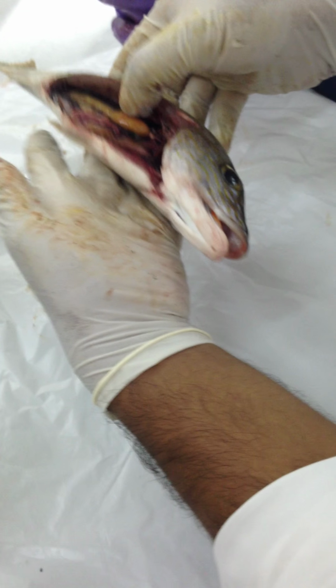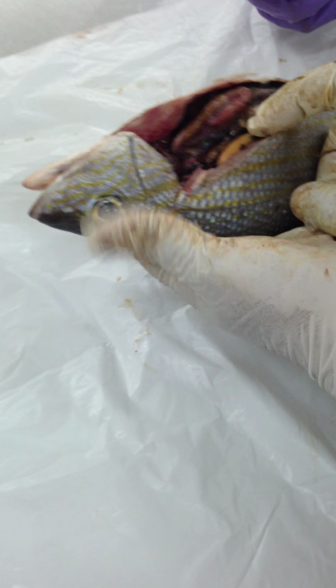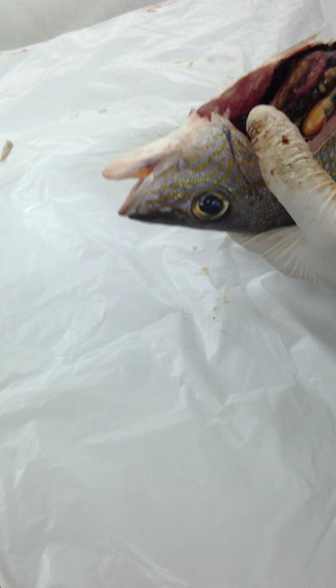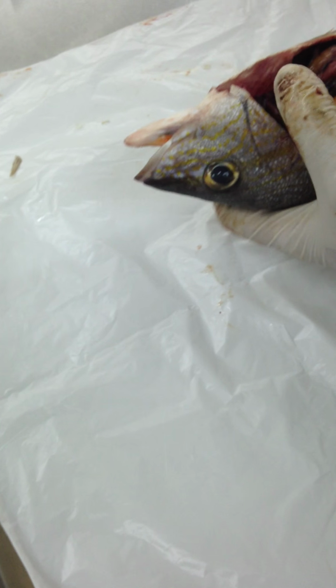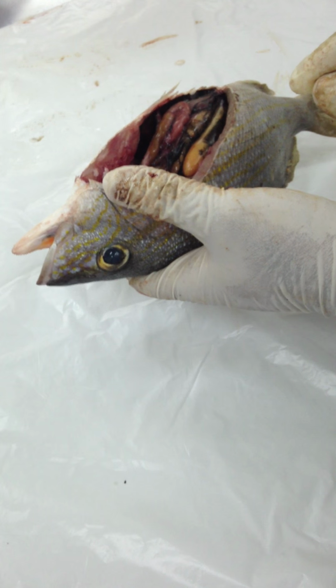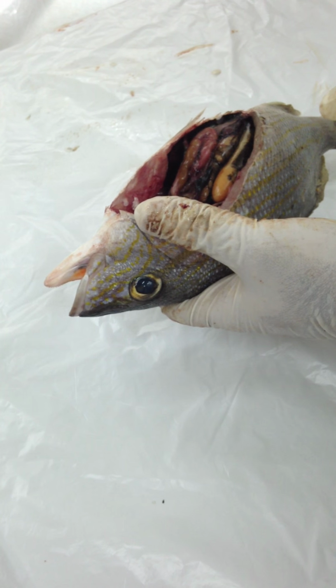Well, he's going to lean over the table. Okay, that's okay. I can get a probe. We're going to have to take our probe out? I didn't bring my probe. I think we did. There's definitely a probe out, or anything which would be useful in pointing the structures. Got it, I got it.